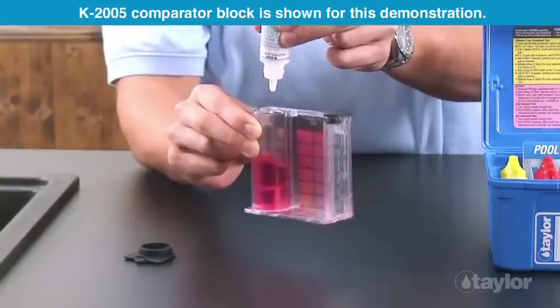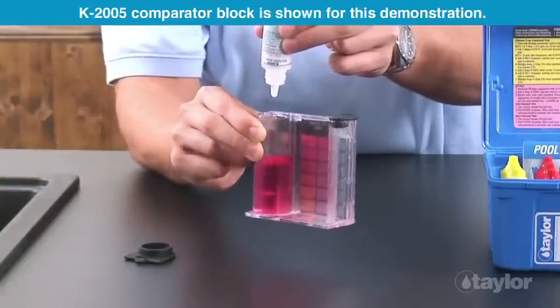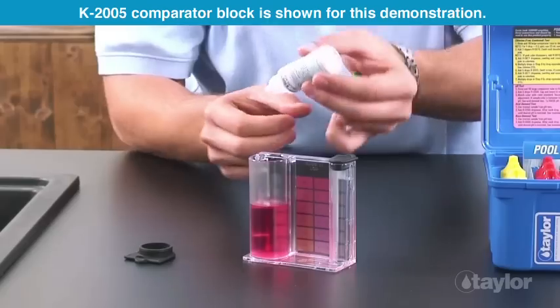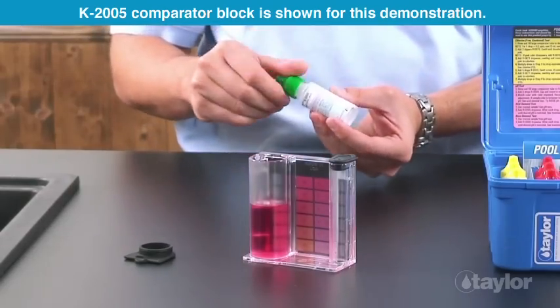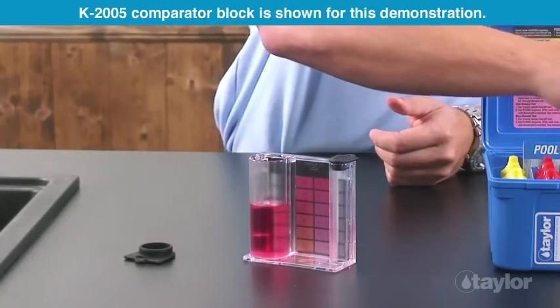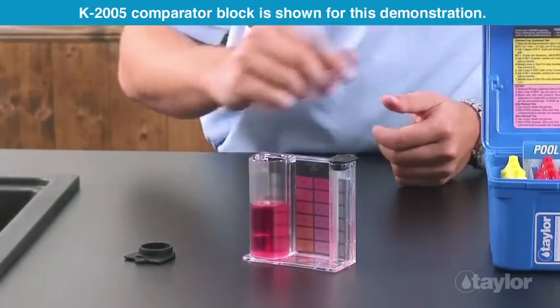Multiply the number of drops from the previous step by 10. Record as parts per million total alkalinity as calcium carbonate.